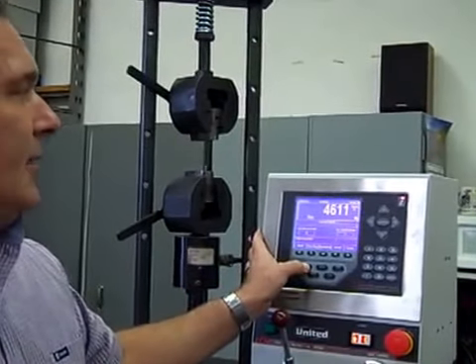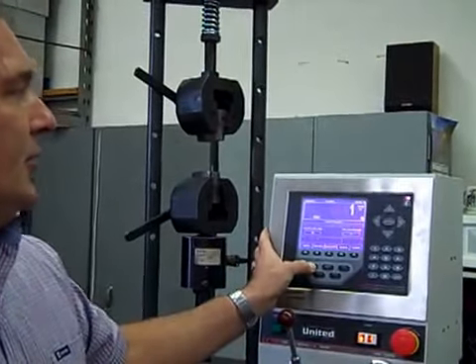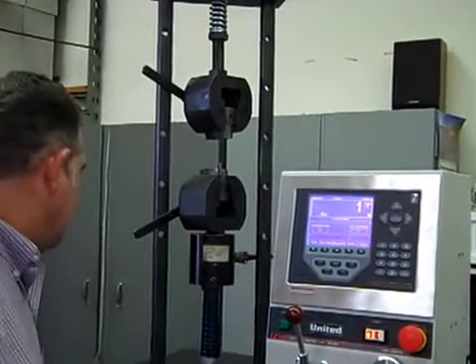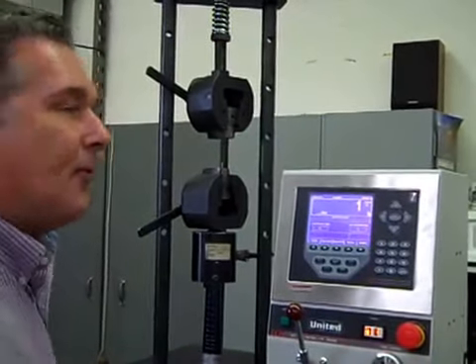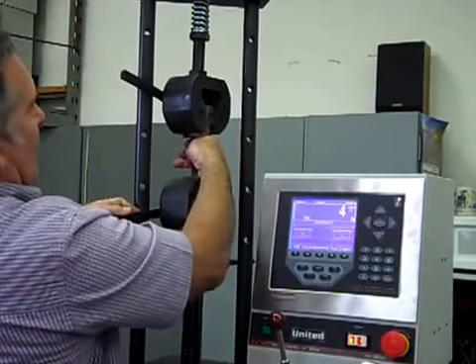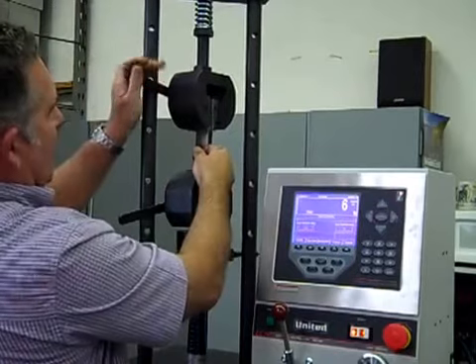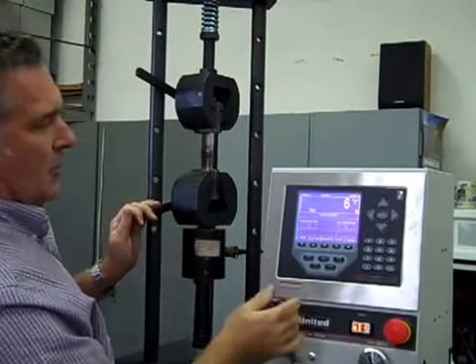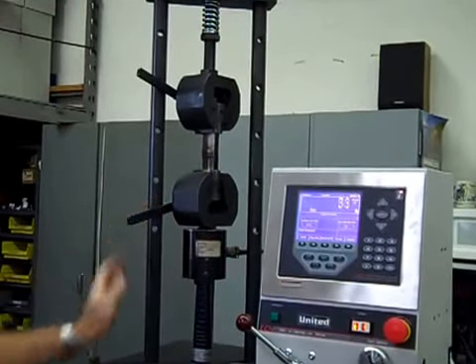The operator then zeroes the machine, and the tester is ready for the next specimen. Snugging the grips, put the machine in gear, and there she goes.